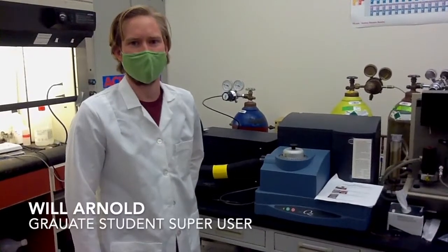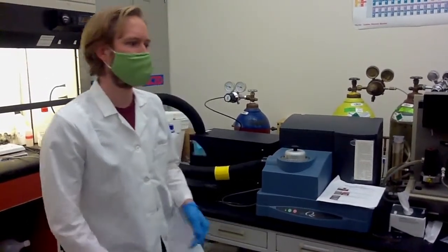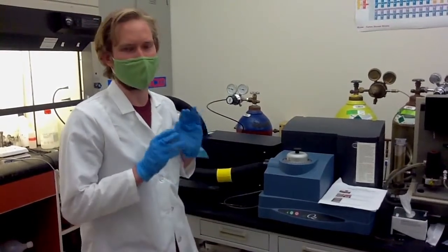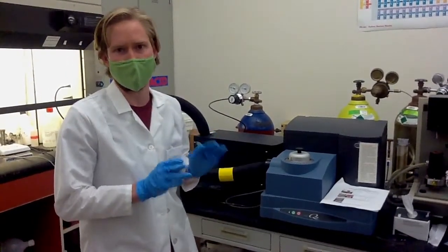Today I'm going to show you how to run the DSC instrument, including turning it on, sample preparation, setting up the software, and saving the data.